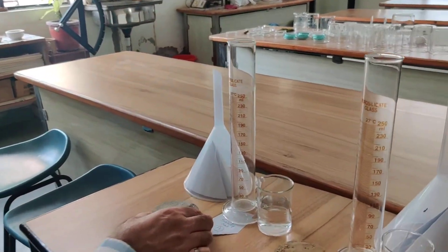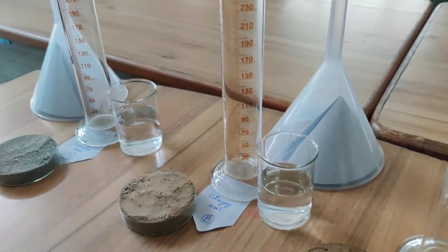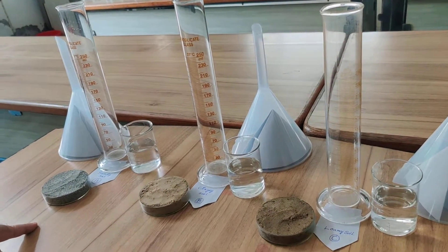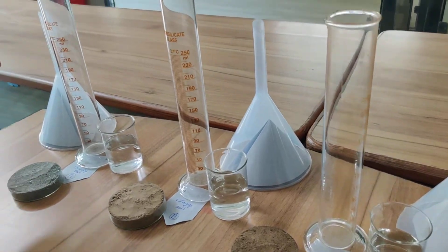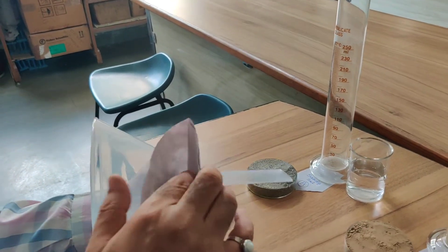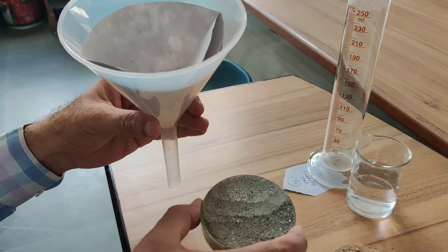For this experiment we require all these equipment. We have here three soil samples: this is sandy soil, this is clay, and this is loamy soil. Beside, we have three measuring cylinders. The soil should be of the same weight — we have taken 100 gram sample of each. This is 100 ml water in each beaker. These are measuring cylinders and these are funnels in which a filter paper cone is fitted.